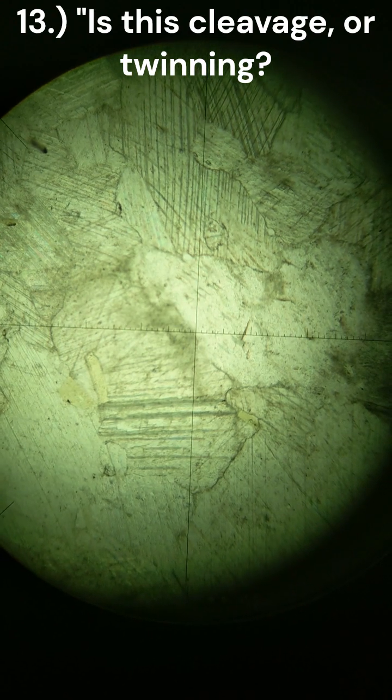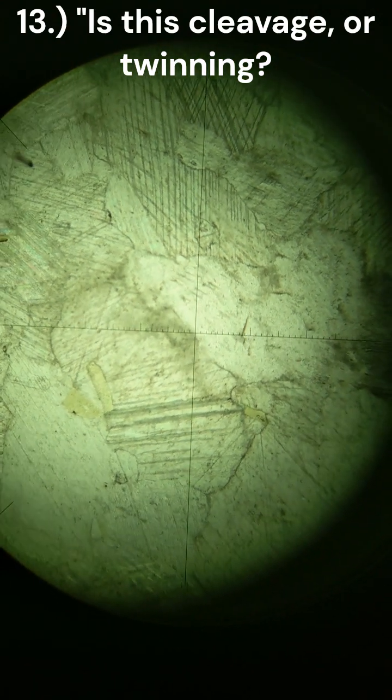Working on slide 72, 4x magnification, gypsum out, PPL. I believe this slide is mostly calcite. I think that because of this 60/120 cleavage. I do not think this is twinning.